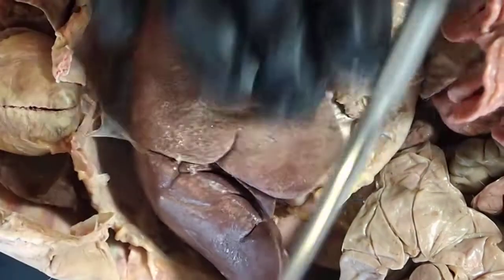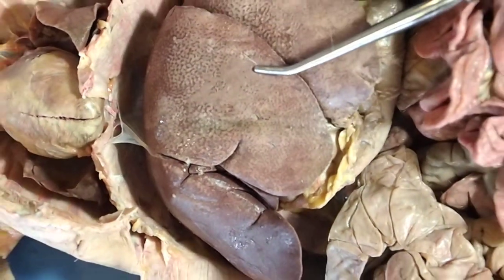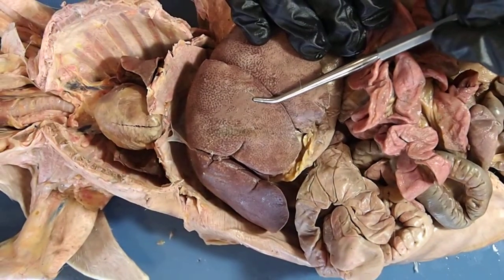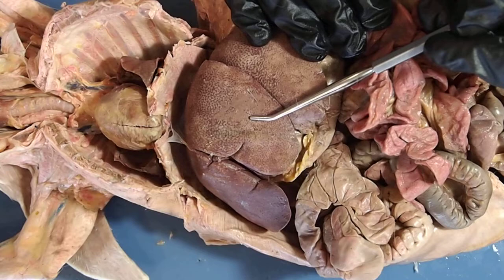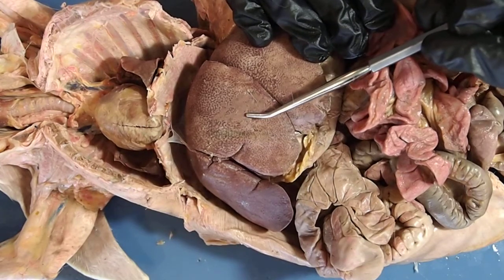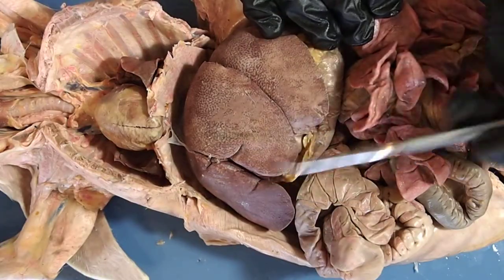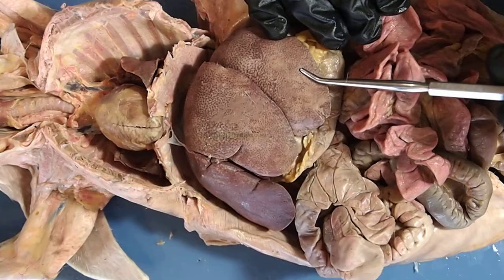The liver, the largest abdominal organ, is involved in a whole range of digestive and metabolic processes. It detoxifies many substances for us, processes nutrients, and stores some vitamins. It is a very large, hard-working organ that takes up most of the space of the abdominal cavity.